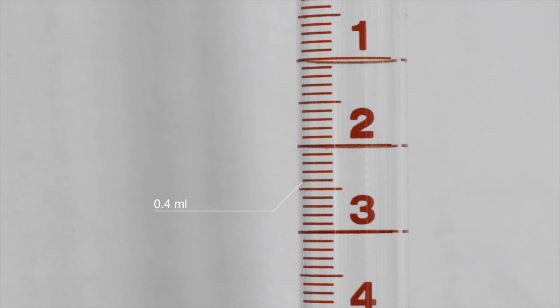The next and final type of line is the one that appears to be slightly longer than the lines above it. This line represents 0.5 milliliters. The smaller lines under the 0.5 milliliter would then represent 0.6, 0.7, 0.8, and 0.9 milliliters. Then the longest line appears, representing a move up in volume of 1.0 milliliters.